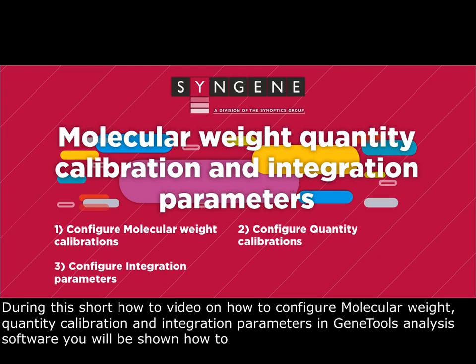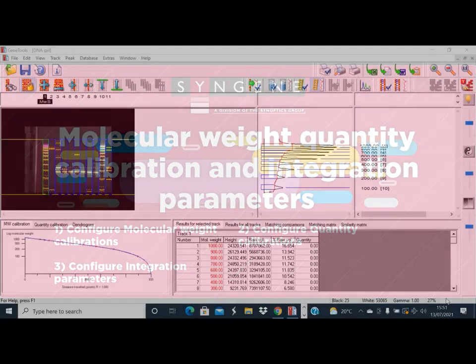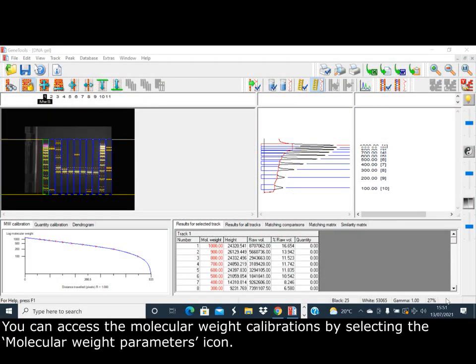During the short how-to video on how to configure molecular weight, quantity calibration and integration parameters in GeneTools analysis software, you'll be shown how to: 1. Configure molecular weight calibrations, 2. Configure quantity calibrations, and 3. Configure integration parameters. You can access the molecular weight calibrations by selecting the molecular weight parameters icon.